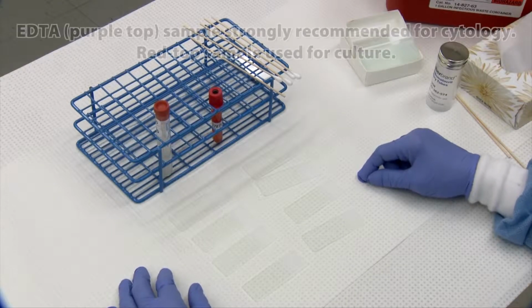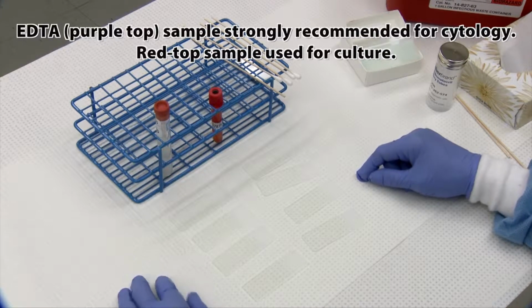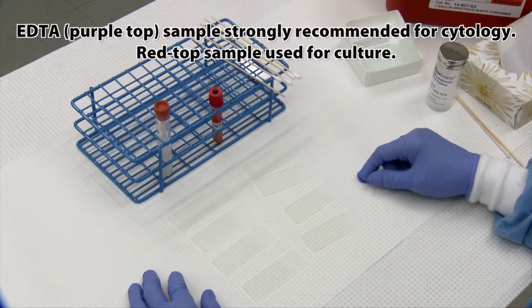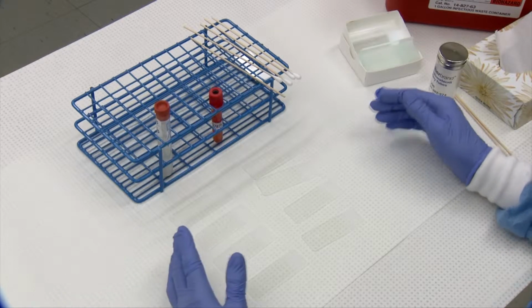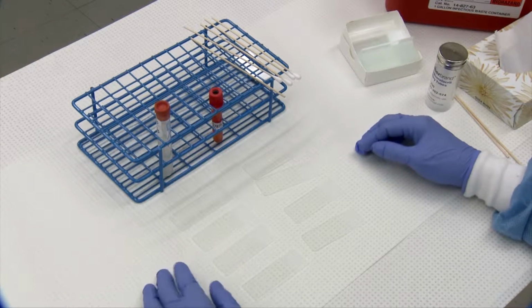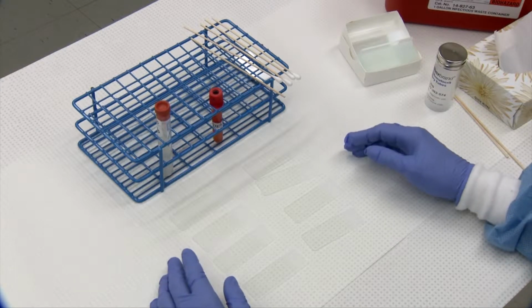This section is going to demonstrate how our lab handles and processes body fluids for cytological examination. Our fluids are basically divided into two types, body cavity fluid and non-body cavity fluid. The slide making process is the same for both.